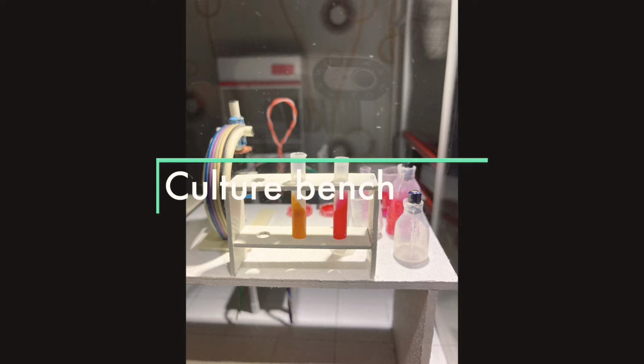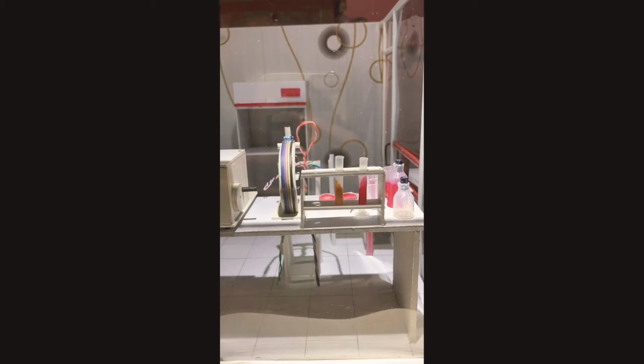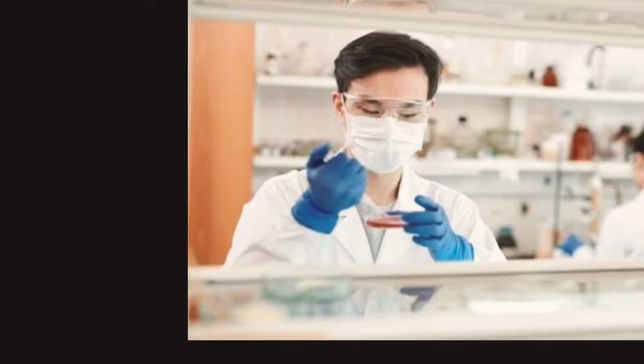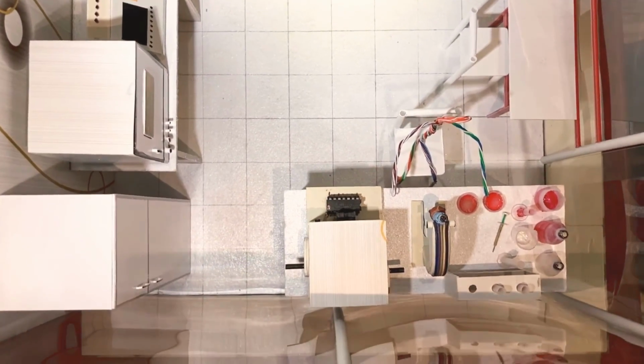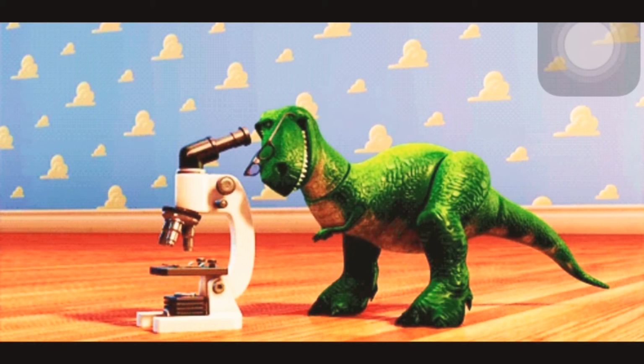This is the culture bench where different human samples such as fluids, tissues, swabs, feces, urine, and blood are cultured in various media to check the causative agent of the patient's disease. In this area, microscopy and staining methods are done to look for any presence of bacteria under the microscope.